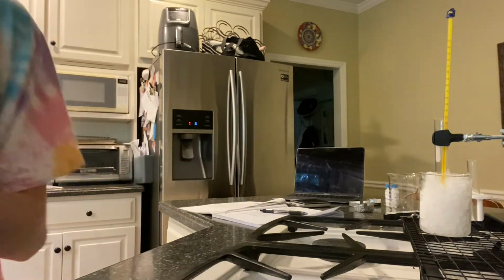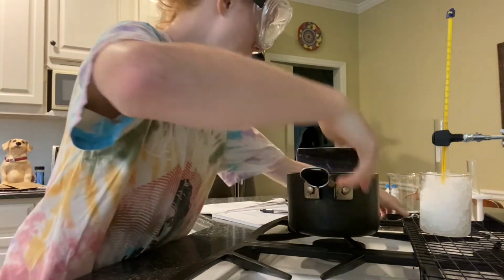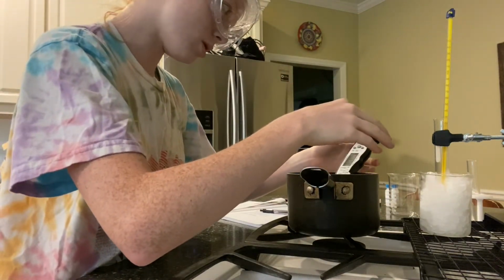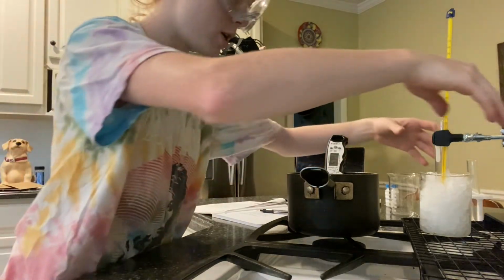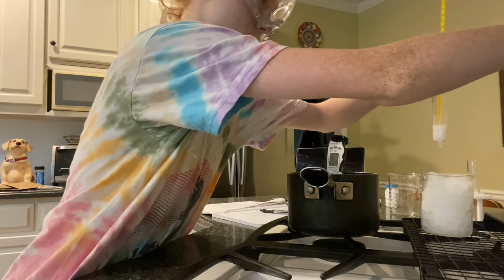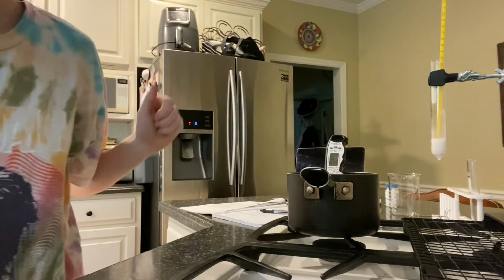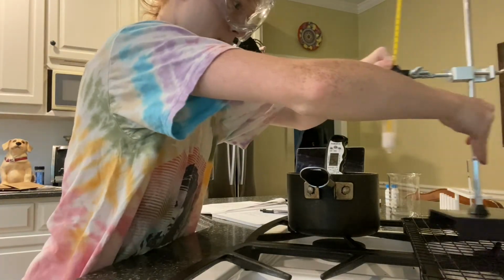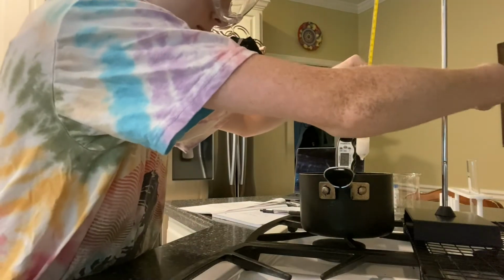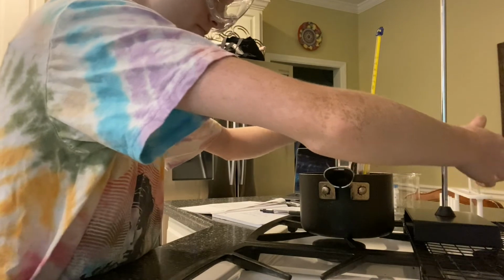So I will bring my hot water bath back. Record temperature, it is good. All right. Move this. Bring this back. And suspend it completely under.